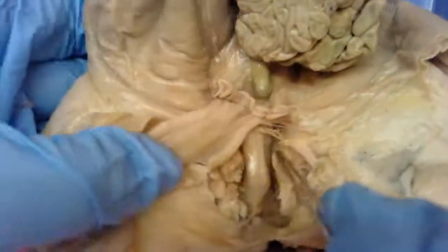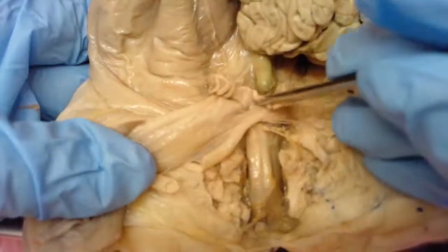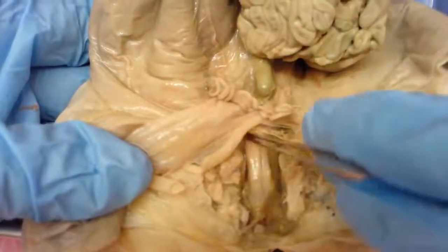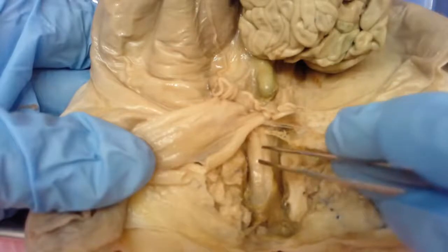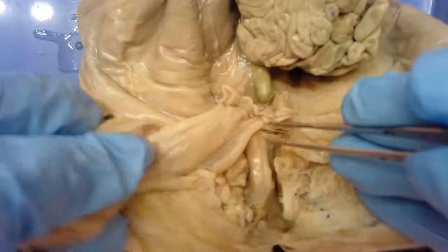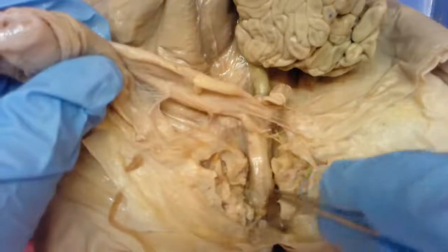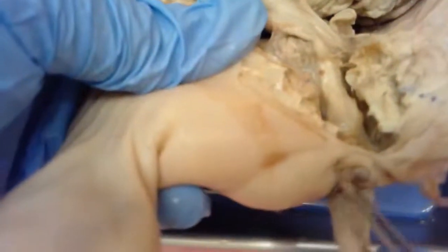This structure going between where the pelvic bone was is the vagina - the birth canal. If I tug on the body of the uterus you can see it pulls the vagina, showing they're connected. The vagina connects with the uterus and those uterine horns. Laying on top of the birth canal or vagina is the urethra - that's where urine exits from the urinary bladder. The urethra comes down and connects here, and there's a common area where they join at the urogenital opening.